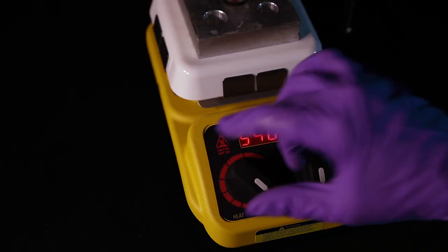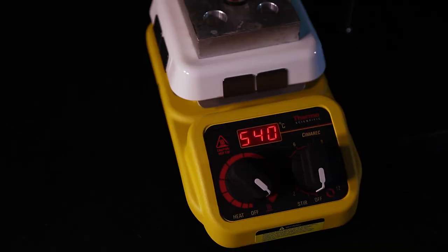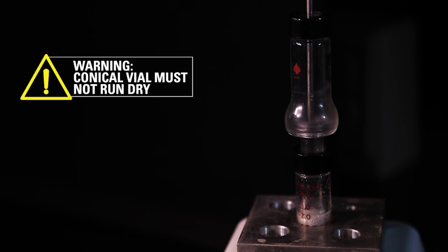This mixture will need to be heated well in order for the distillate to reach the stillhead. You might need to set the hot plate to max to generate sufficient vapor. The material being collected will accumulate on the lip of the stillhead. Do not allow the distillation pot to run dry.